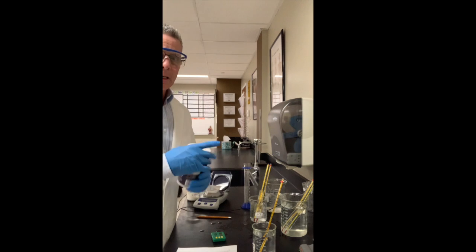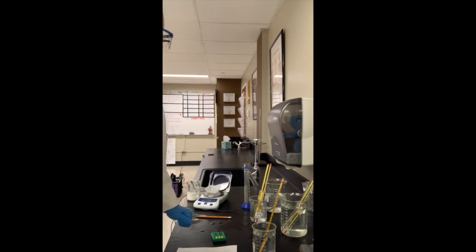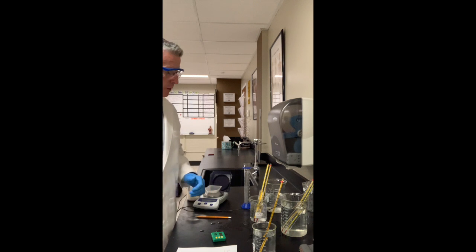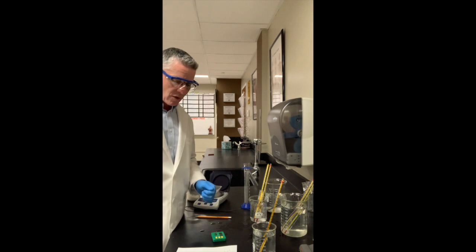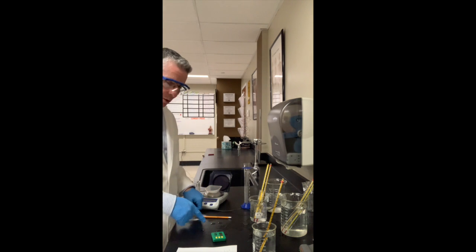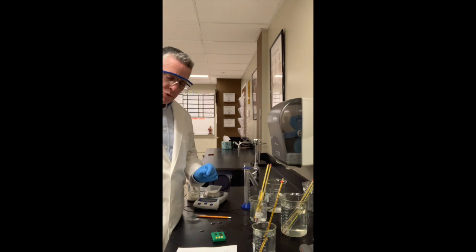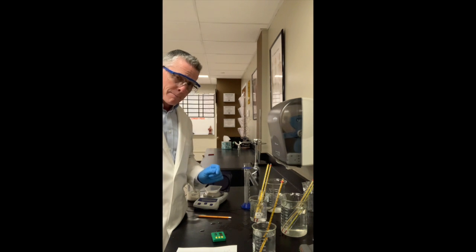In fact, even though I added ice and some salt, I was able to drop it from 7 or 8 degrees to 3 degrees, but I wasn't able to get it much lower than that. So this is my starting temperature, time 0. I am now waiting to check my temperature. I will check my temperature every minute.